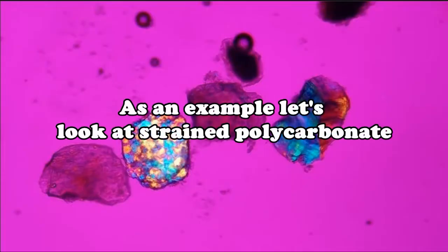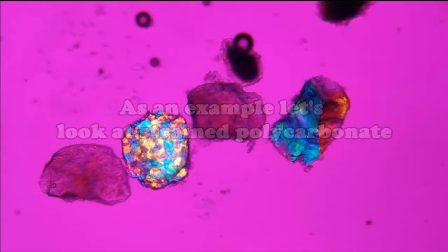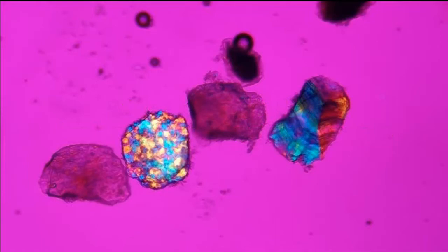As an example, let's take a look at some polycarbonate that's been heated, stretched, and run in a tumbler for a little bit to beat it up, the way you might find a particle that's been collected on a surface. Here we have a couple of fairly typical amorphous particles. We have a polycrystalline particle, which often happens when the plastic cools rapidly.